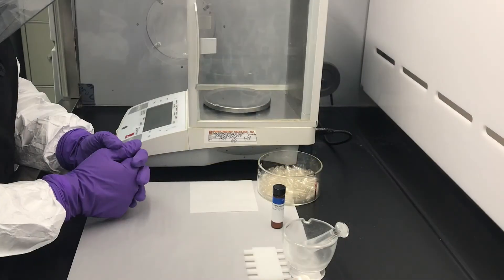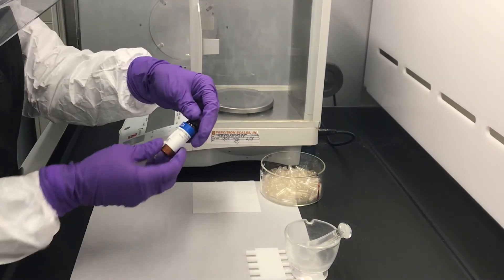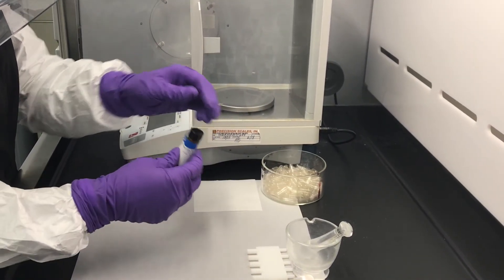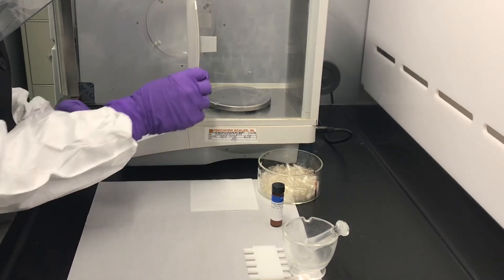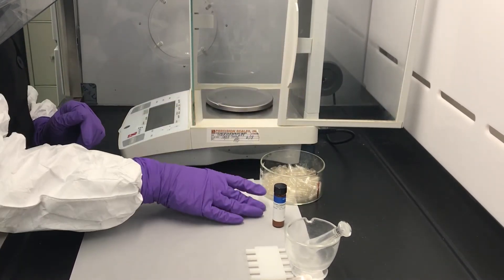For demonstration purposes, I have magnesium glycinate here. We will be using this to determine the pack stat for a size one capsule. There are some other calculations to convert to additional capsule sizes.